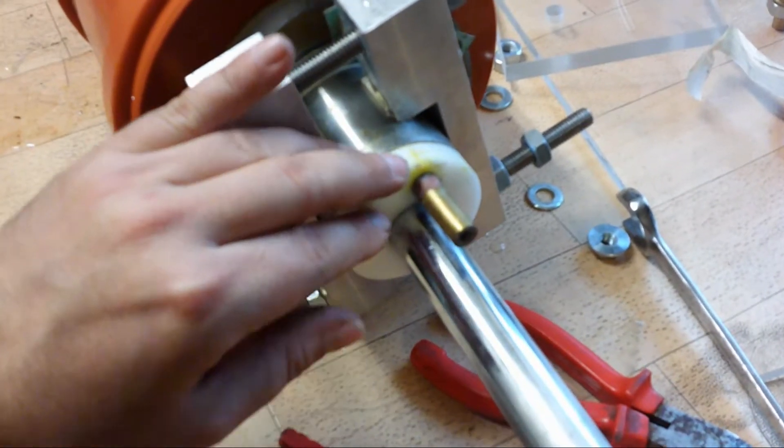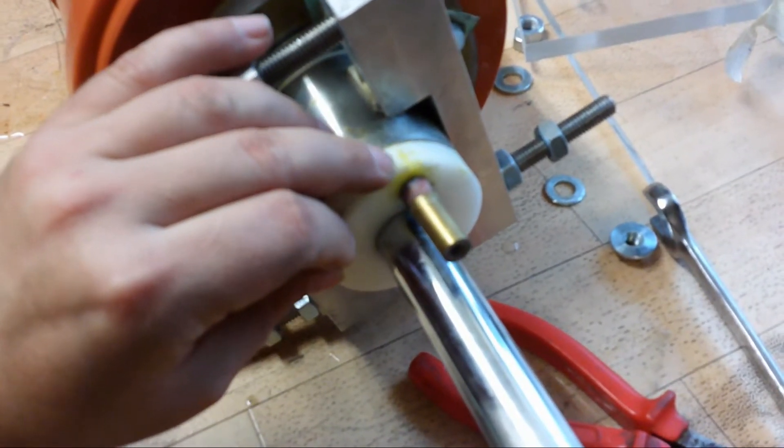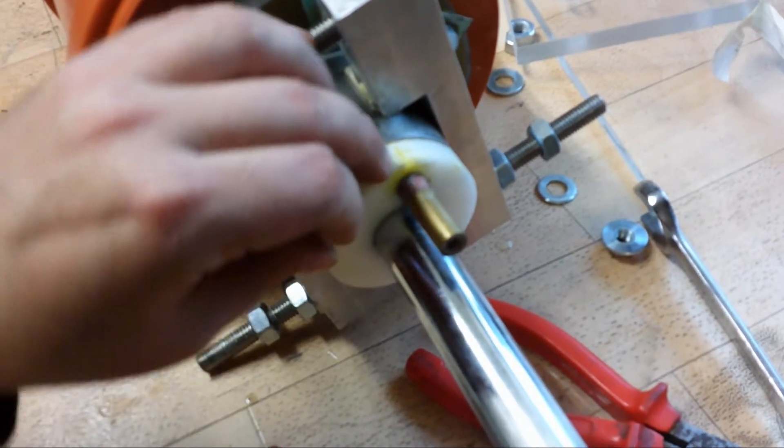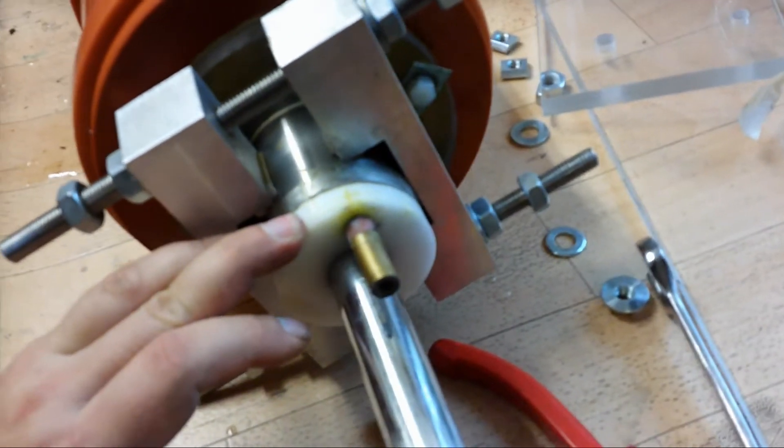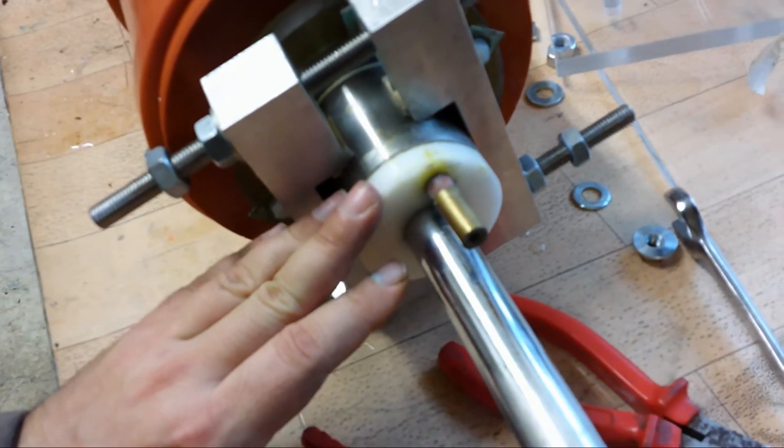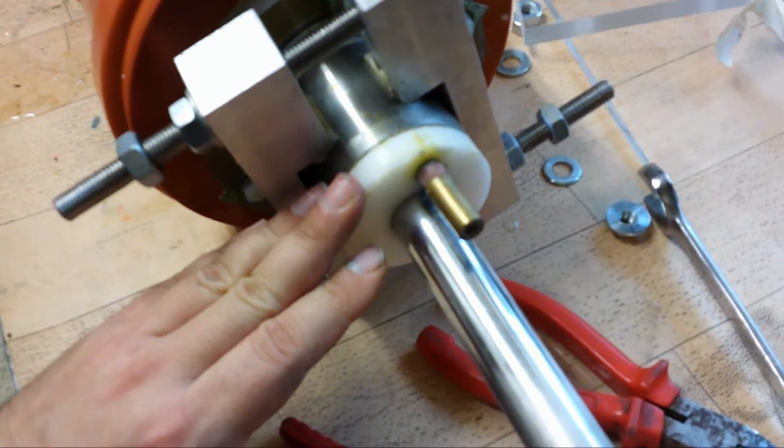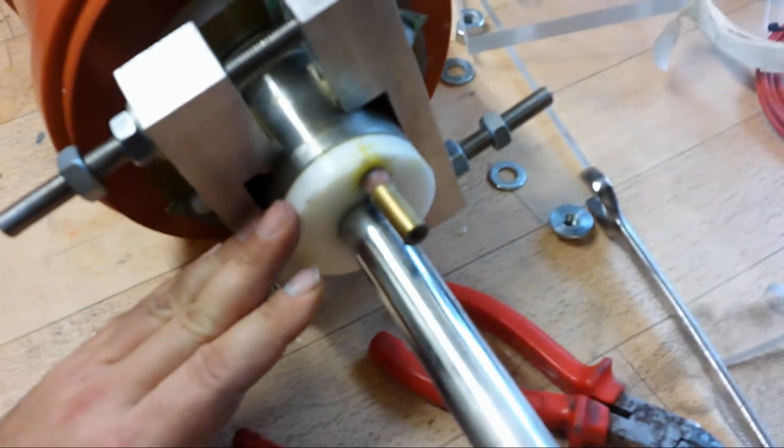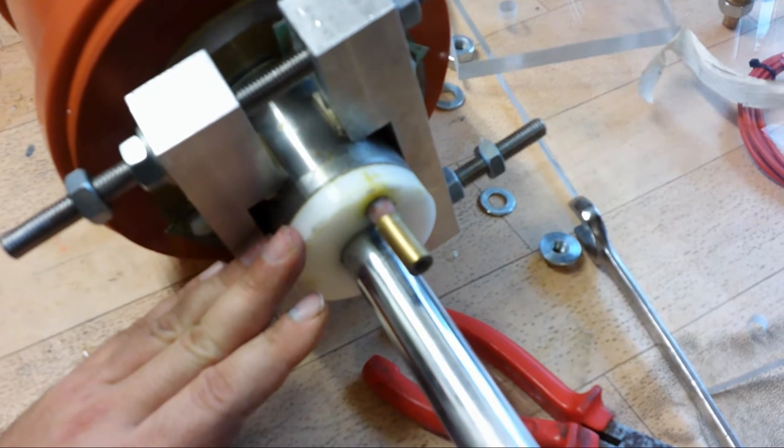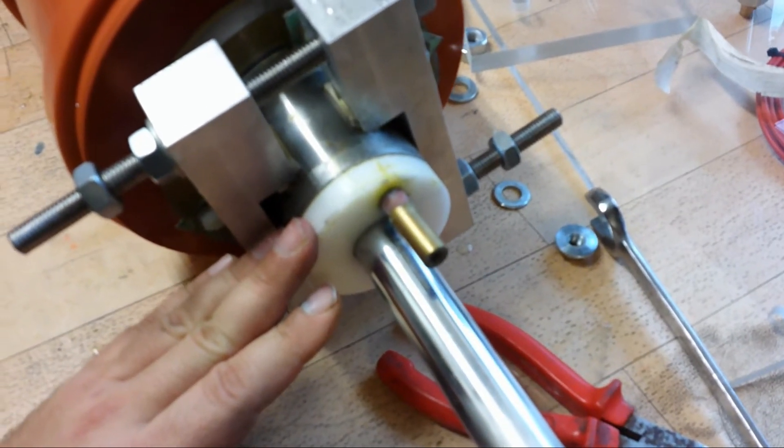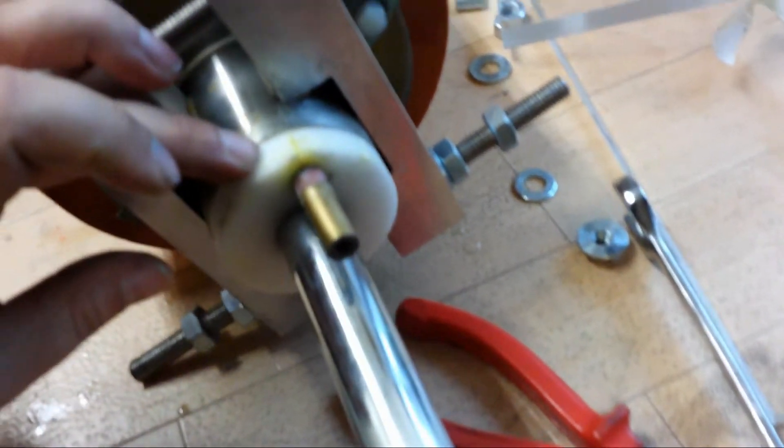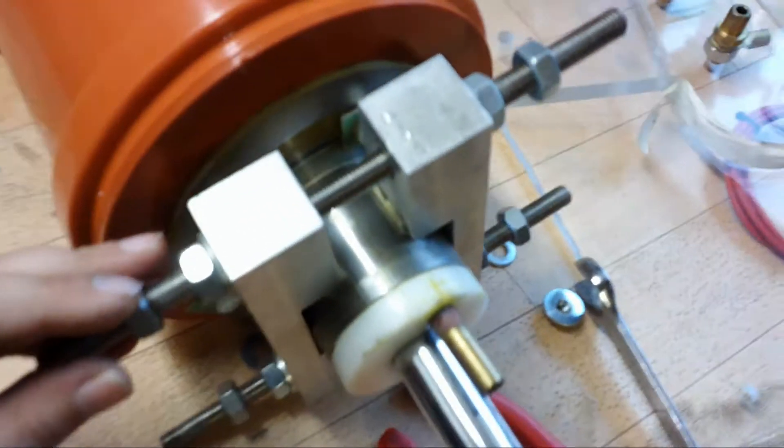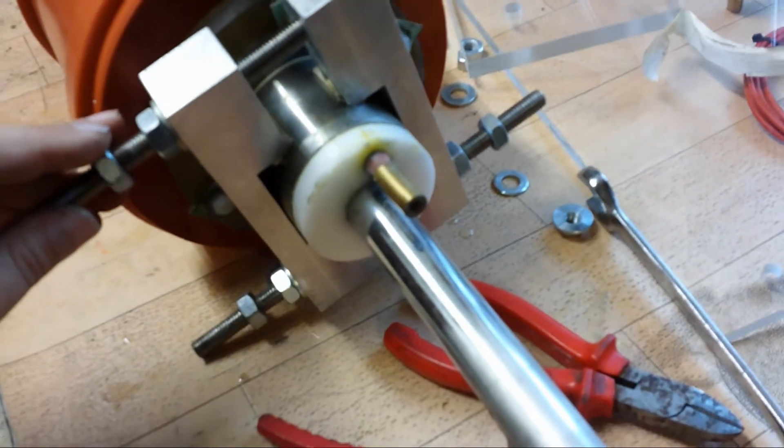I have probably found the leak where the NO2 was coming out. Because here is a crack in the plastic. That was probably the issue that I didn't find when I had it in operation the last time. But as I told it is six or seven years ago. Okay, let's go on with disassembling.